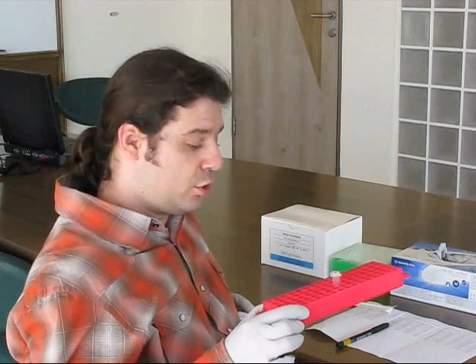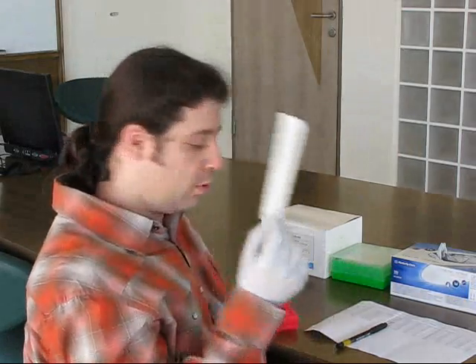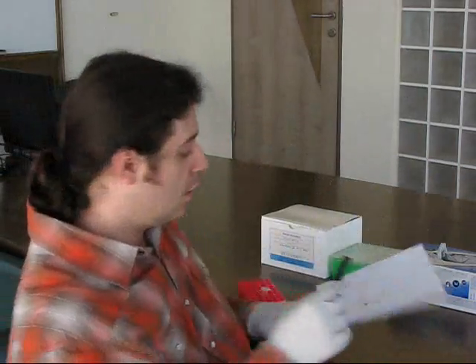Hi, my name is Gennady. I am going to use some things: a stand with tube, sticks for these samples and marking.